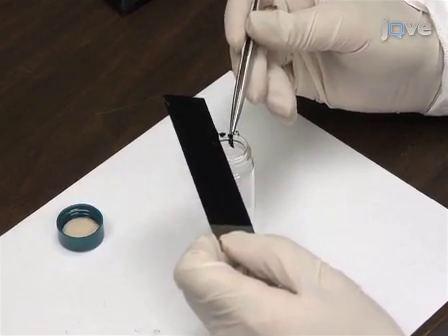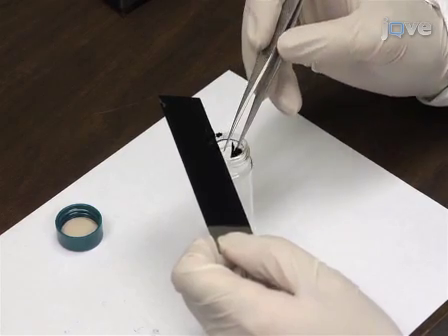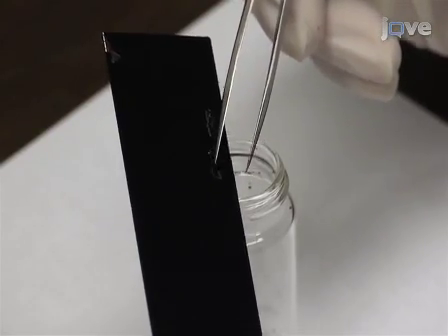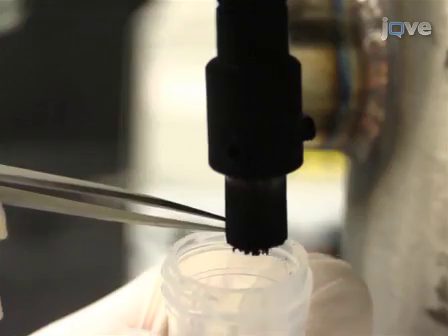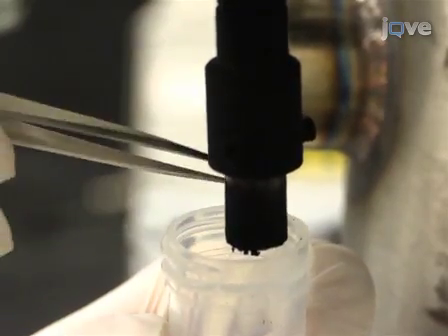When the synthesis is complete, use tweezers to tear off the deposition flake from the surface of the molybdenum sheet where the arc plasma jet was directed. Collect another sample from the black collar of the cathode.